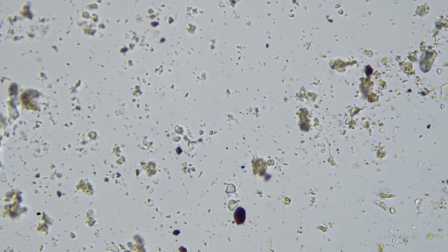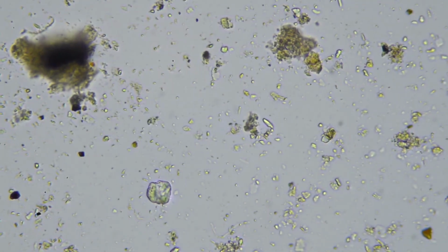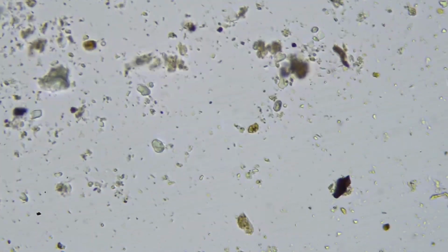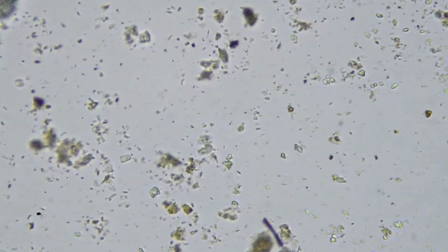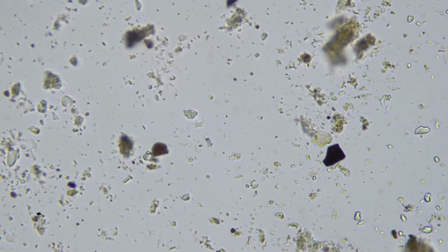So yeah, very interesting. I can see it's definitely actinobacteria that are quite prevalent, but I haven't seen any fungi so far. This is of course not necessarily representative of your field, but let me just have one final scan and see if I can spot one zoomed all the way out, and then I can show you what a fungal hyphae would look like.